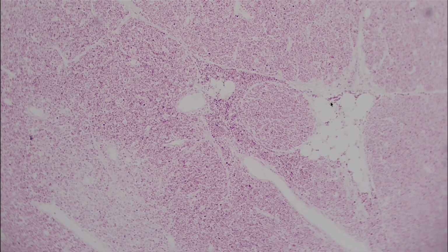So here, we can definitely still see these fibers. We're definitely still surrounded by these little dots you see everywhere. But I'd just say, definitely know those fibers, definitely know what these little cells look like. That is important for reticular tissue.